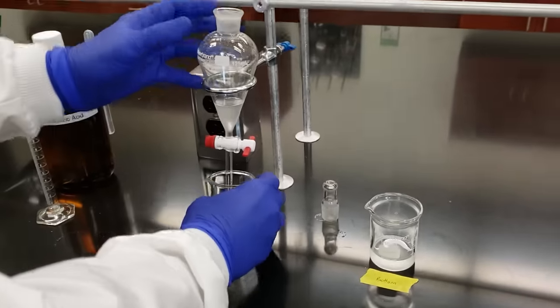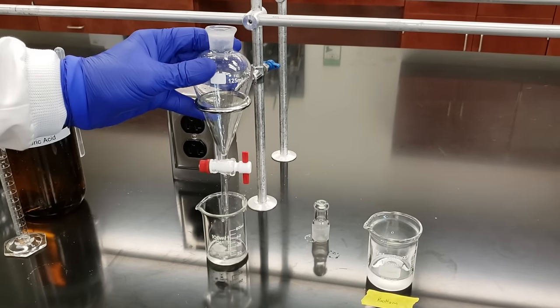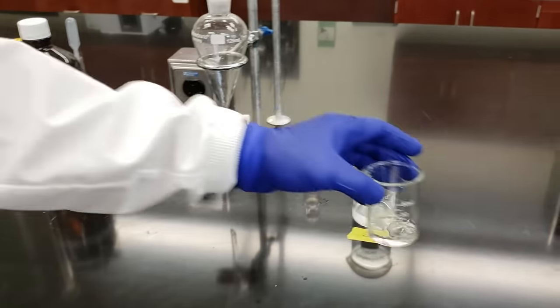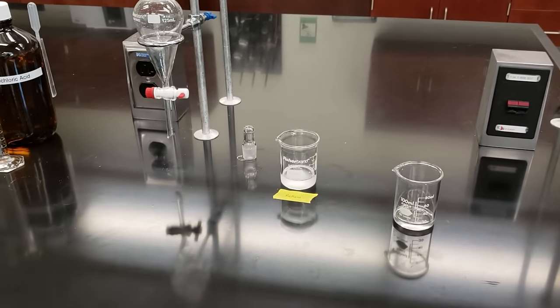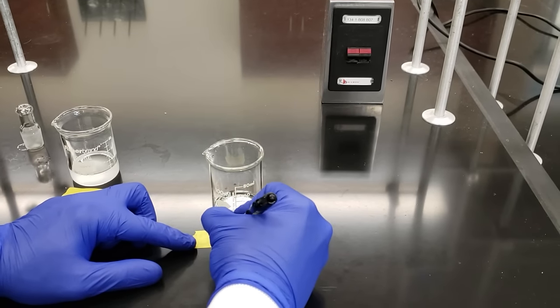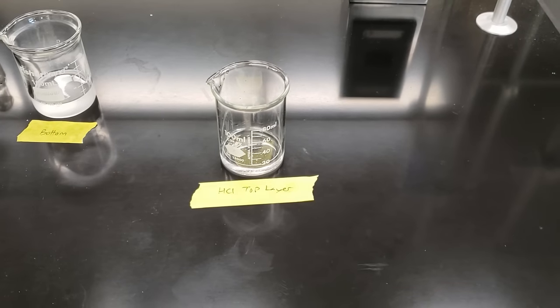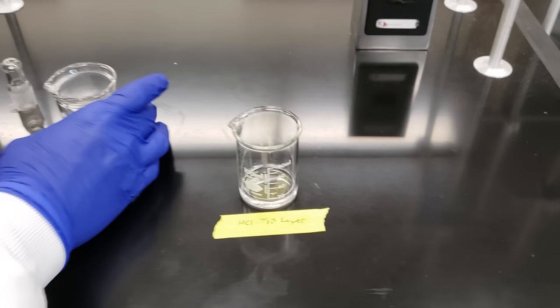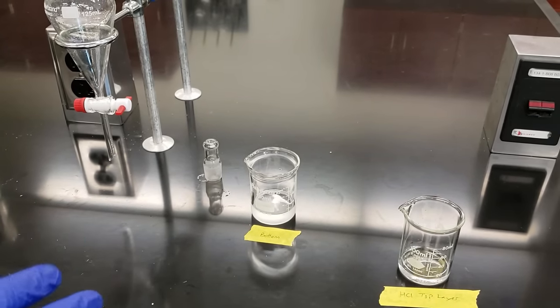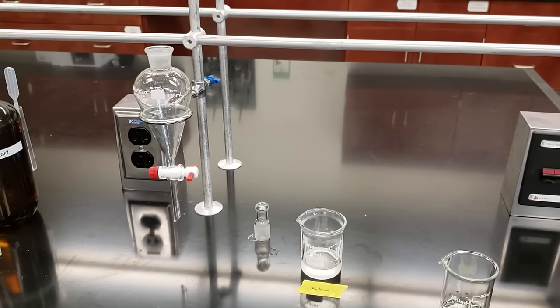I'm going to use a second 100 mL beaker to drain the top layer. I'll label it with tape as 'HCl top layer' so we know what our aqueous solution was. We always want to keep track step by step of which layer is which. Our bottom layer is our methylene chloride; our top layer is our aqueous HCl solution. I'm going to put this methylene chloride back into my sep funnel and then add another 10 mL of 2 molar HCl for the next step of our extraction.